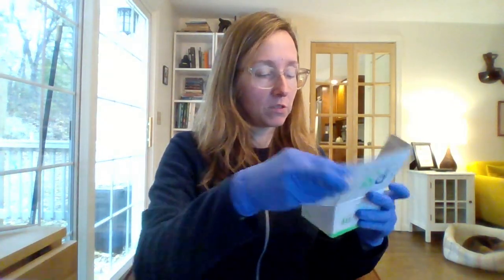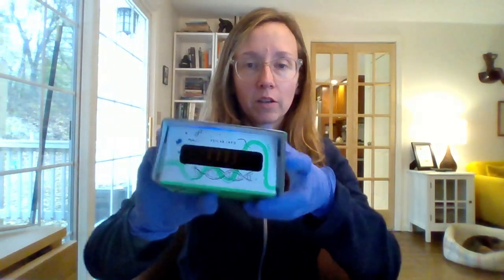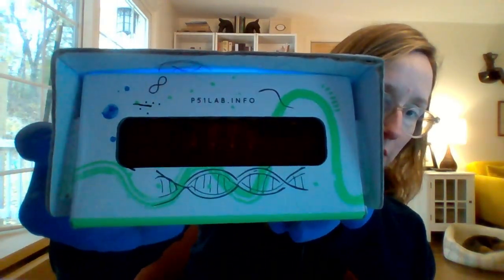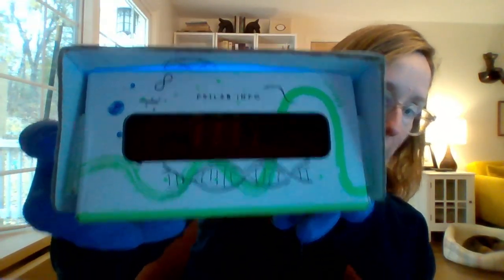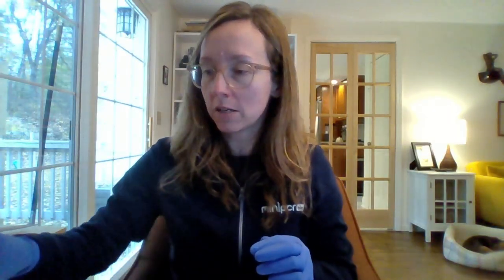So this is my P51. I am going to put my tubes right in the center wells of the P51. I'm going to turn on the light. The light switch is in the back of mine. And we'll just take a quick look at these before any time has elapsed. So yes, you can see my tubes. The light is on, but we don't see any fluorescence in those tubes yet. And that is what we want to see. No time has passed, so we haven't had a chance yet to produce any RNA or proteins. Okay, good confirmation. Nothing is happening when we initially begin.